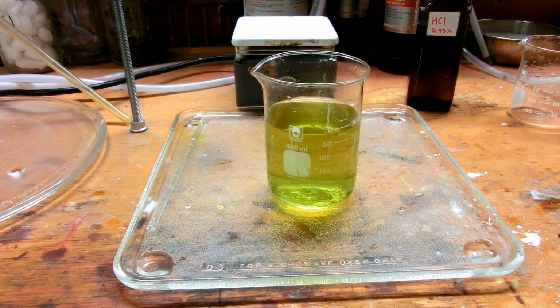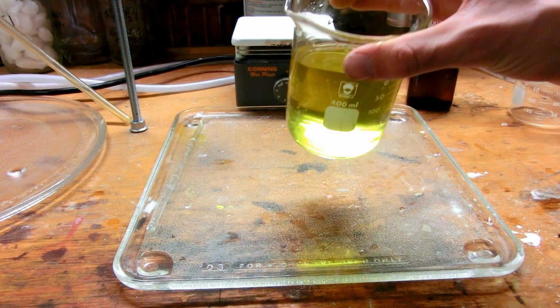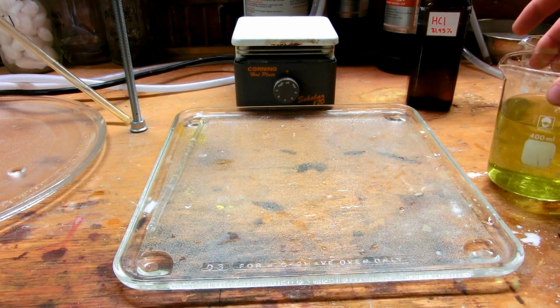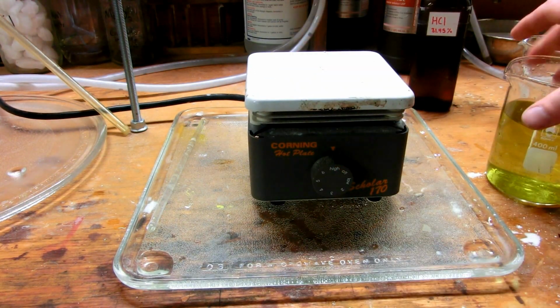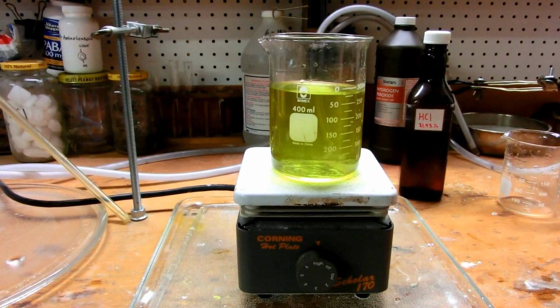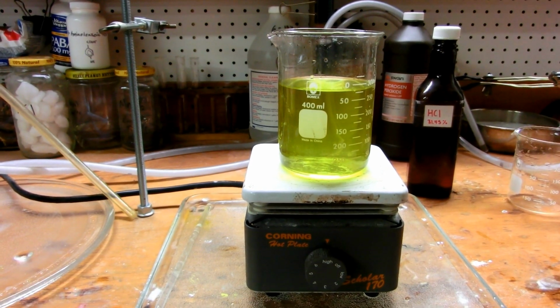I'm not really sure which one this is, but what I'm going to attempt to do now is heat this up to drive off the hydrogen chloride gas by boiling, and then hopefully precipitate our iron oxalate. So hot plate, turn it on high, solution on top, and I'll begin boiling this, and then I will take video as soon as it is boiling, and then we might be able to see it precipitate for me.